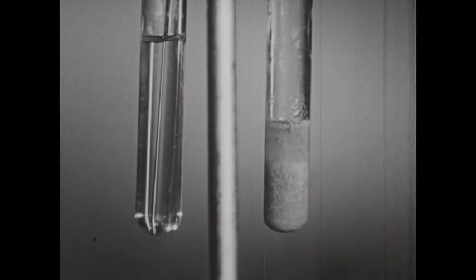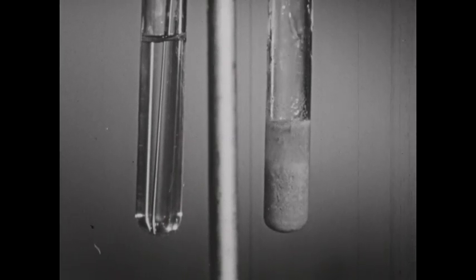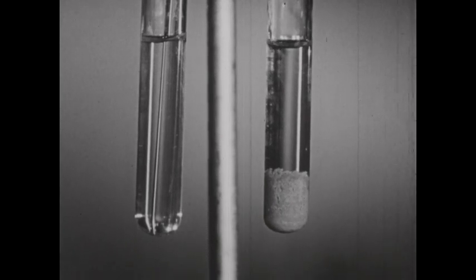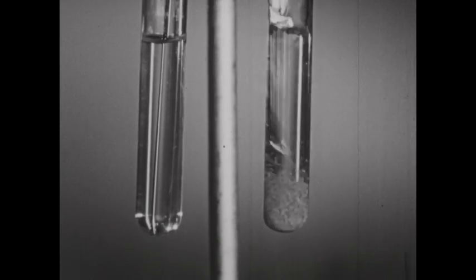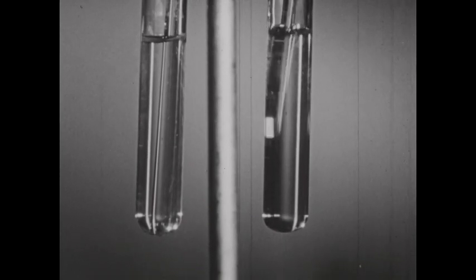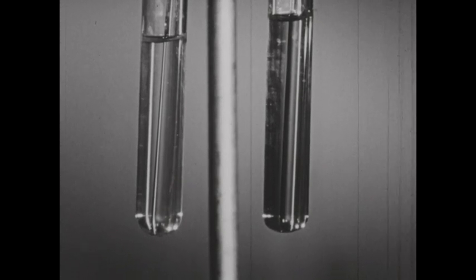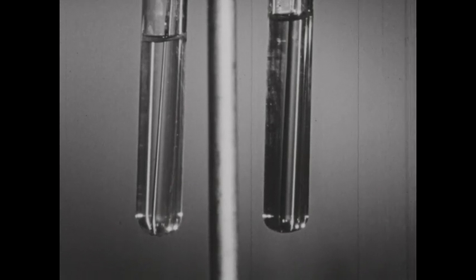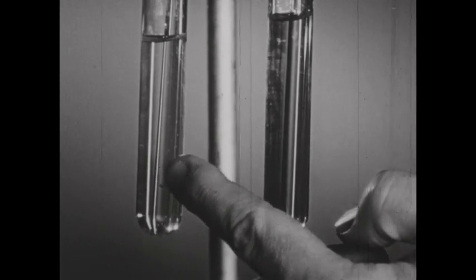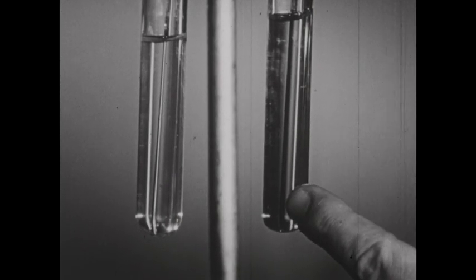To the tube on the right, concentrated ammonium hydroxide is added, and once again the precipitate dissolves. The ammonium hydroxide reacts with the silver ion, forming a silver-ammonia complex ion and reducing the concentration of the silver ion. So in one case, by reducing the concentration of the phosphate ion, we caused the precipitate to dissolve; and in the other, by reducing the concentration of the silver ion, we caused the precipitate to dissolve.